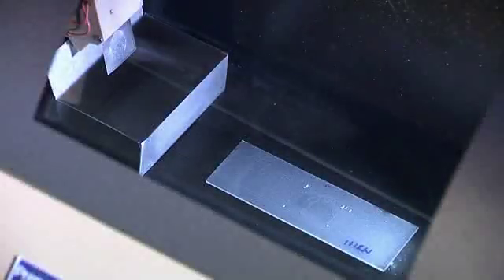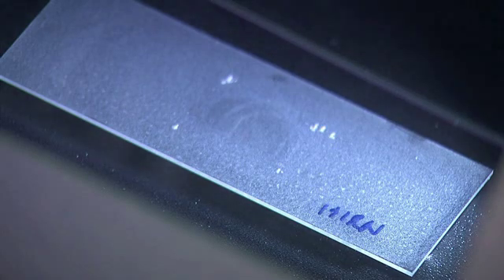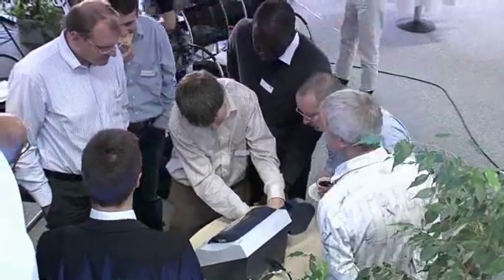It's not a pneumatic spray where you have gas and a gas flow. It is more like rain coming from the top to the sample. This is a wobble — the spray head is tilted by 15 degrees and moves in alternating directions. The Image Prep gives us reproducibility, and with reproducibility comes the possibility of doing larger scale studies.